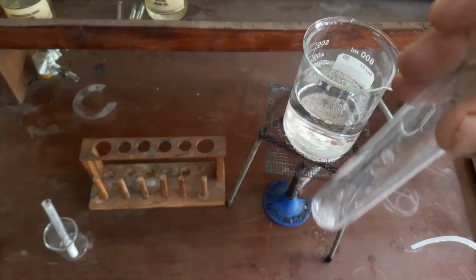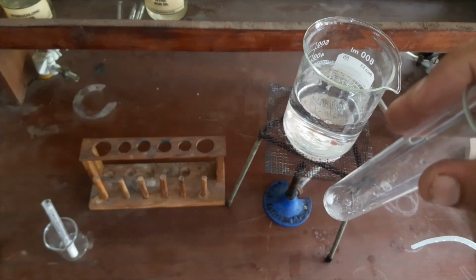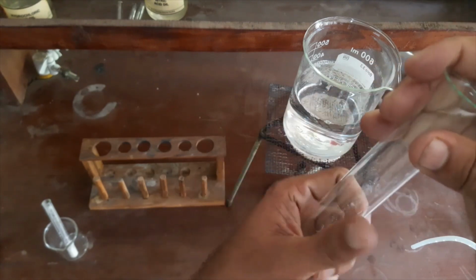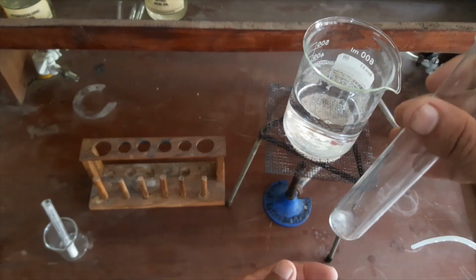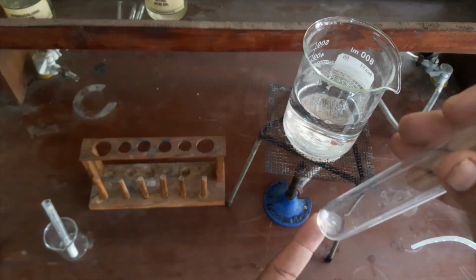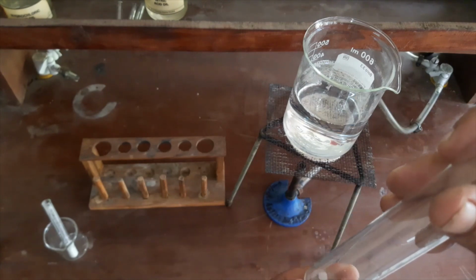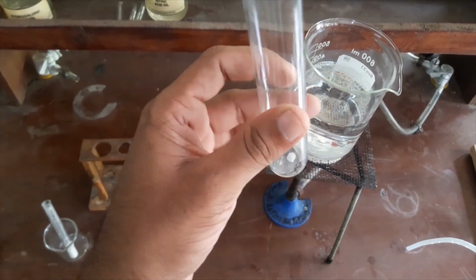Okay, please keep in mind, memorize this: the solvent should not dissolve our chemical at room temperature. Now this tube is at room temperature. You can see the solute is not dissolved in this distilled water. You can see at room temperature it is not dissolved in this solvent. So our trial 1 has now passed.